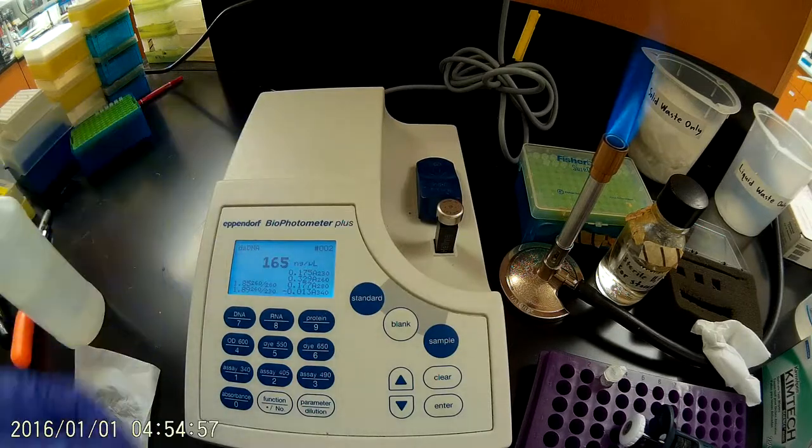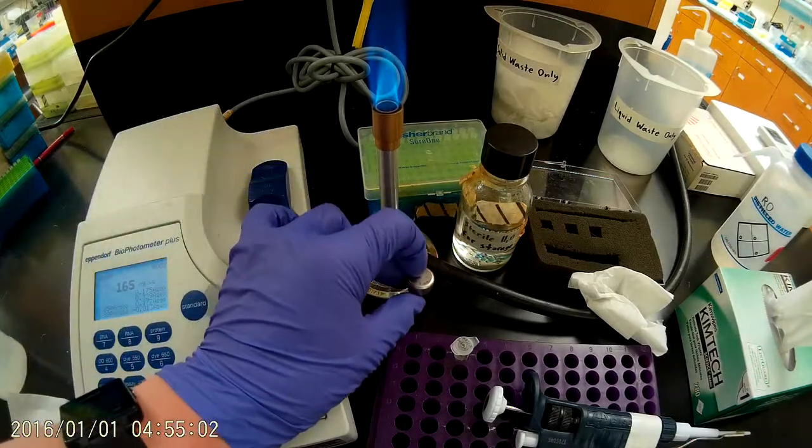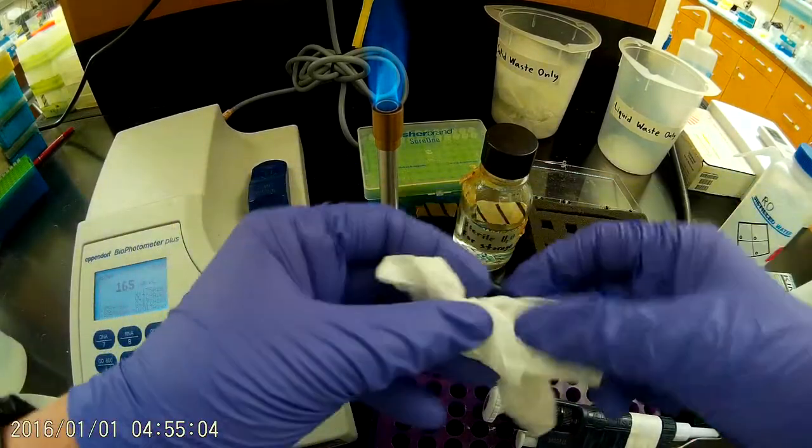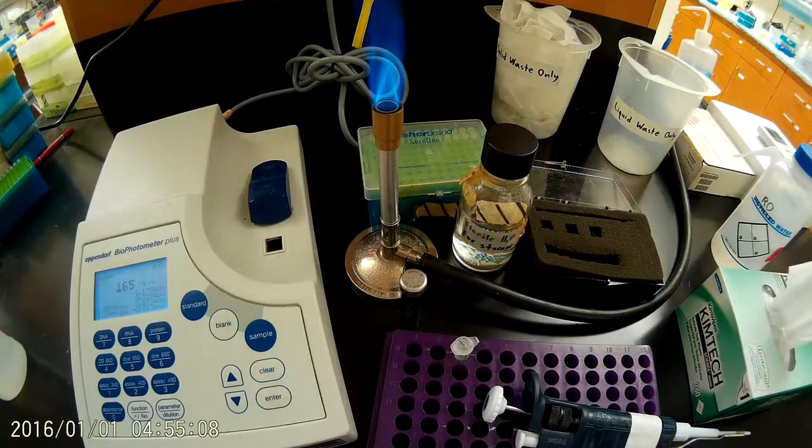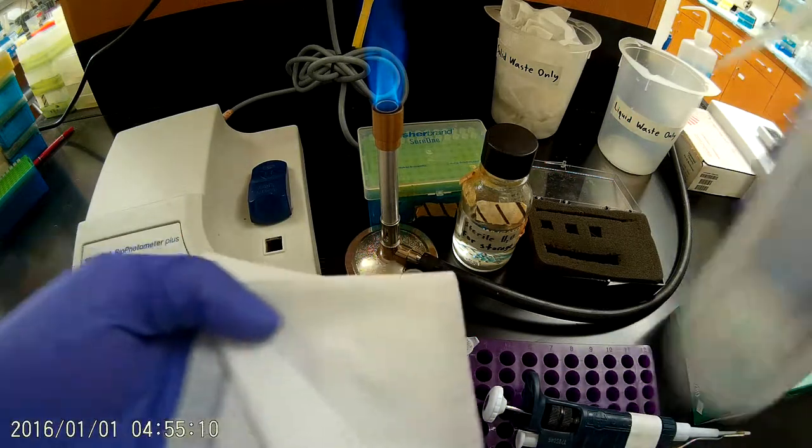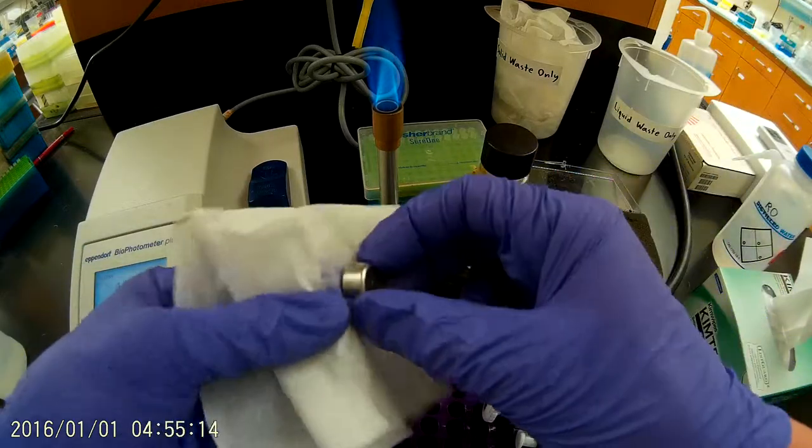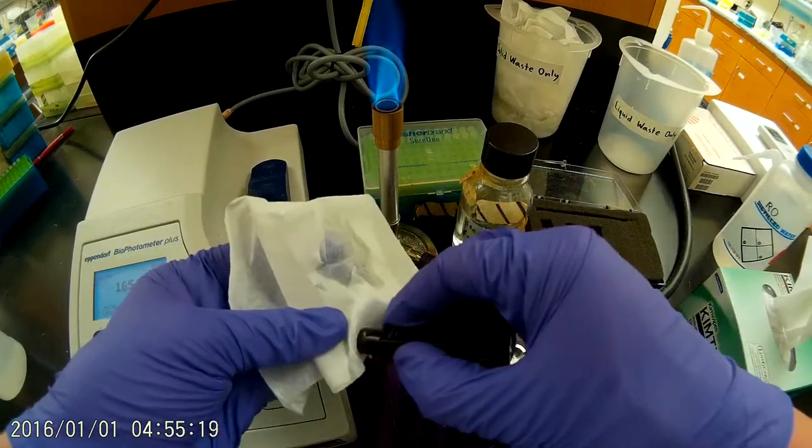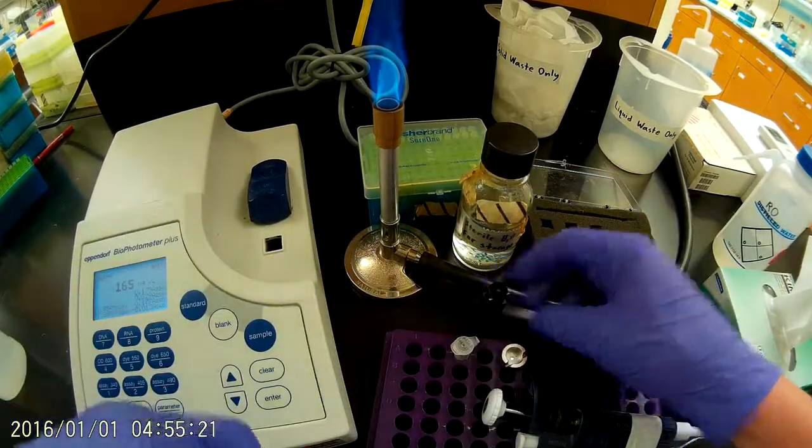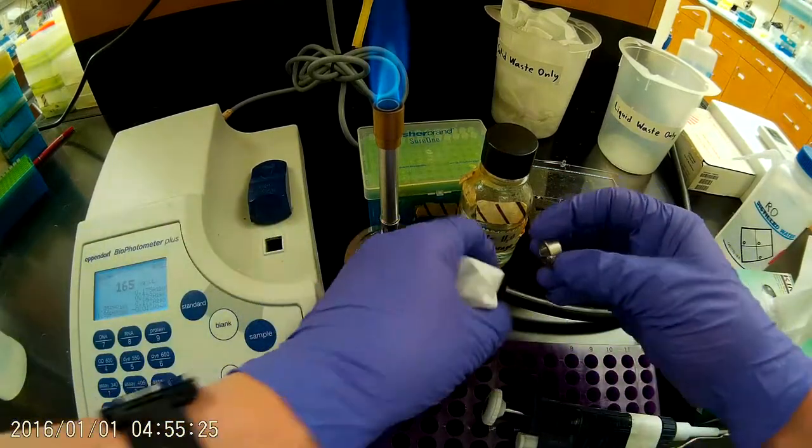All right, so we will record that later. But for now, I'm going to clean off my cuvette again. Throw that away. I'll get a new kim wipe here. So again, dampen that with RO water. Clean off the lid and the tray. Make sure those are dry. And then we'll put that back in the case.